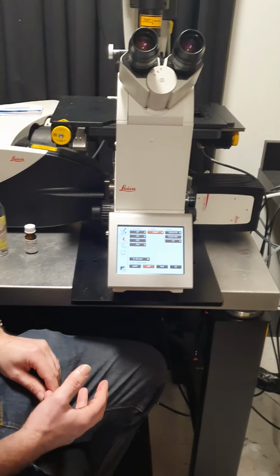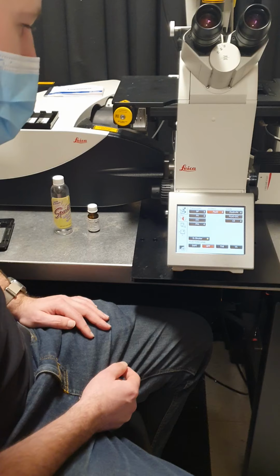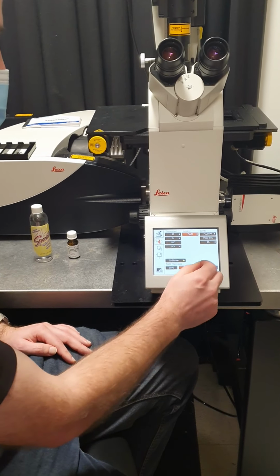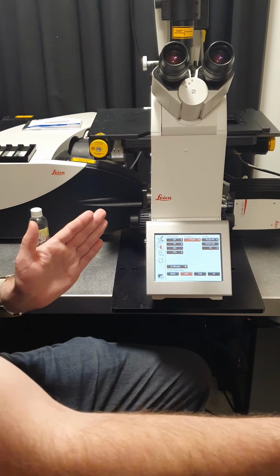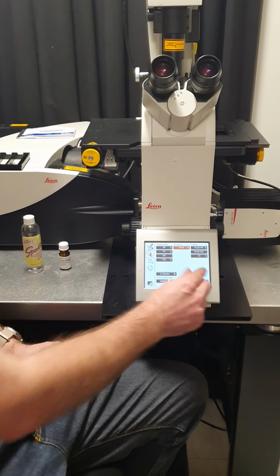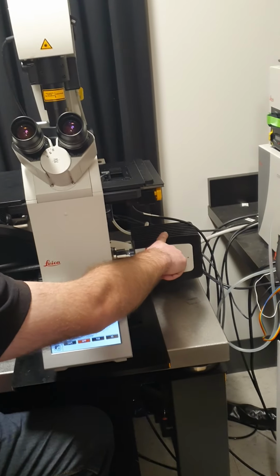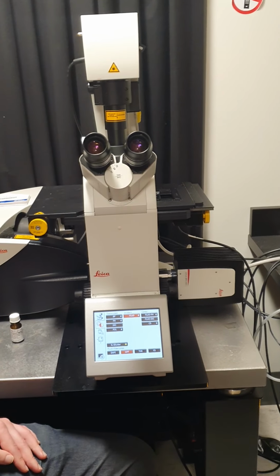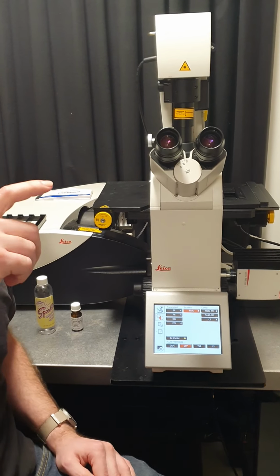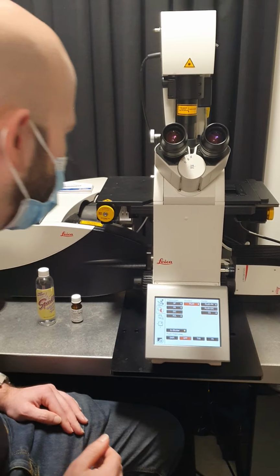Colin, just a question. So I'm familiar with these 3. How can you tell a little bit about this one? So this one, Cy5. So this is further to the red end of the spectrum. Okay. So this you actually will not be able to see by eye. It's beyond the human visible spectra, but the camera can detect it. Okay. And we'll see in the software, it'll show you the filter cubes and you can see the exact wavelength ranges for all of the filter cubes.